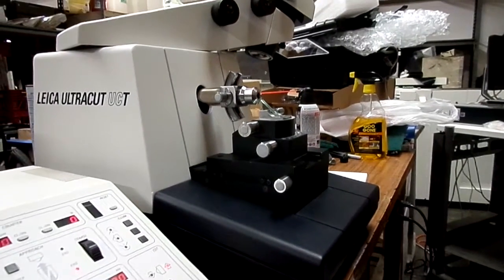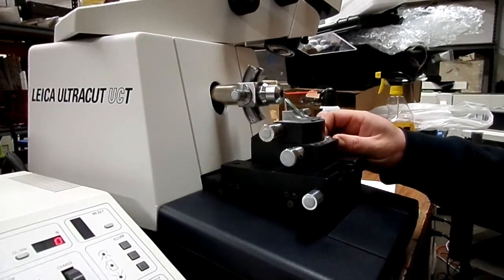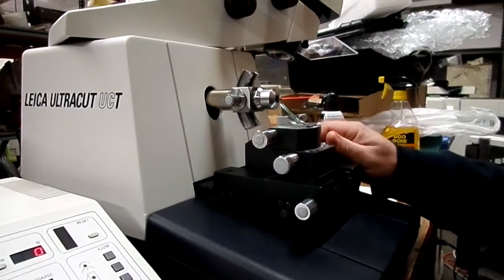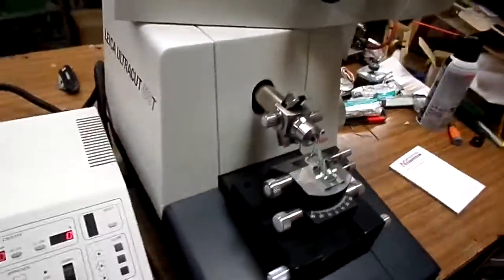So today I'm going to show you how to set up your UCT Leica Ultracut Microtome. There's quite a few adjustments on here. Some are a little trickier than others.